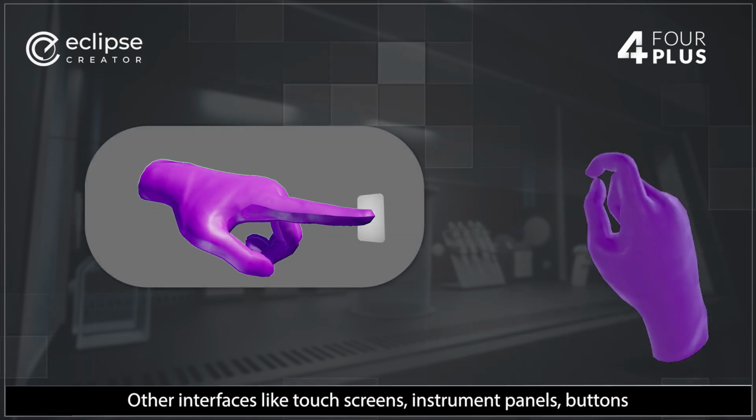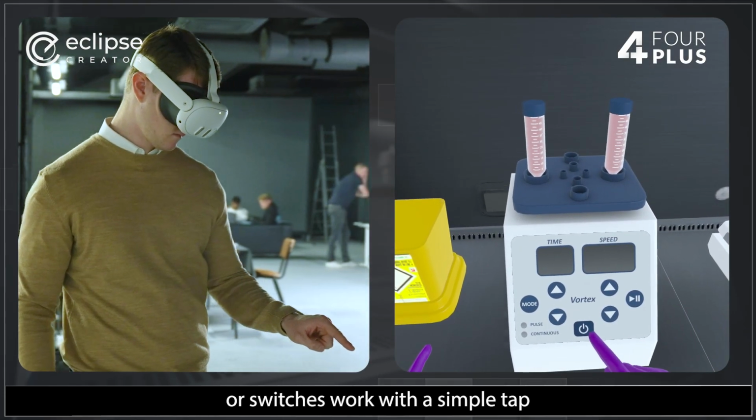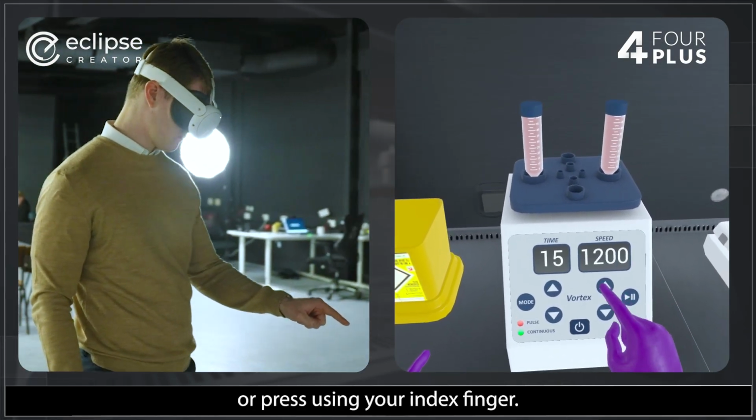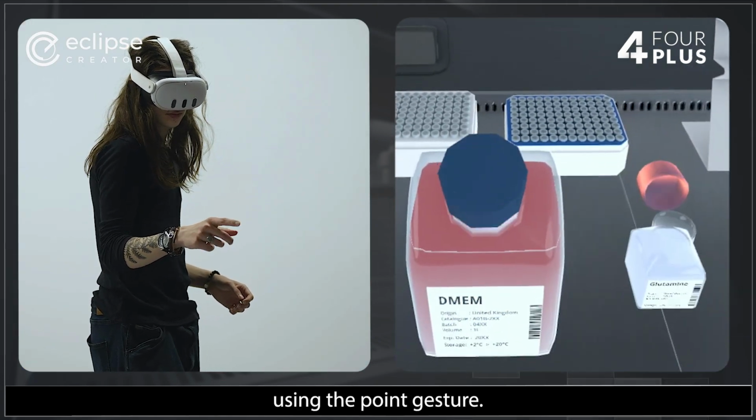Other interfaces, like touchscreens, instrument panels, buttons, or switches, work with a simple tap or press using your index finger. Lids can be opened as well using the point gesture.